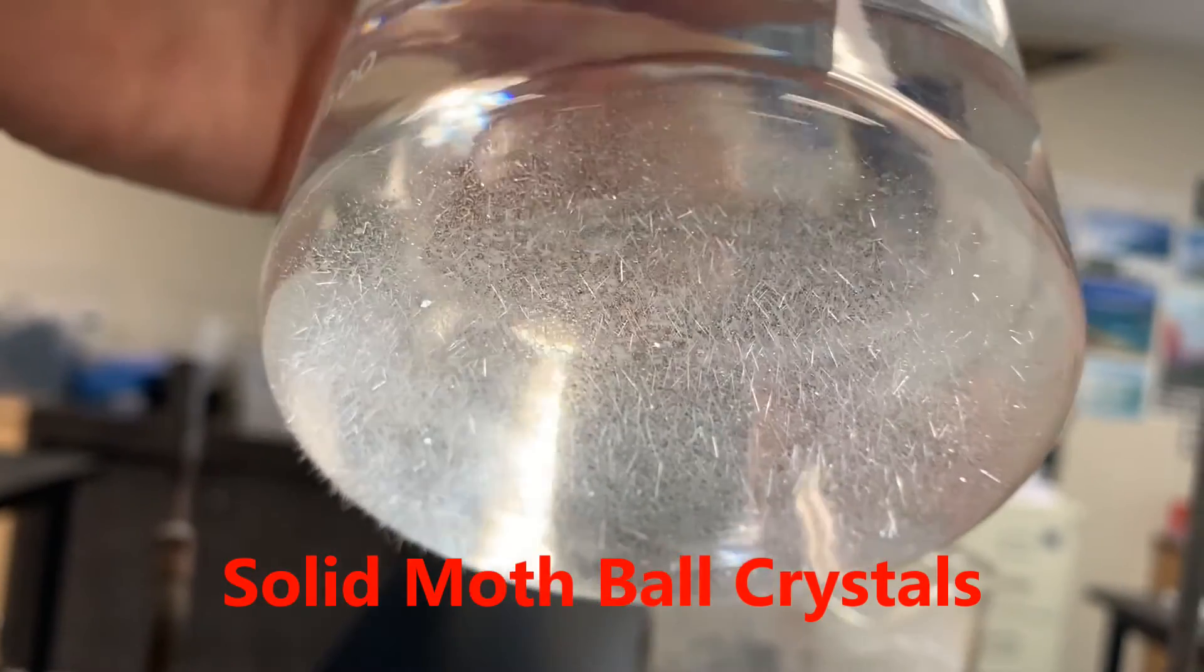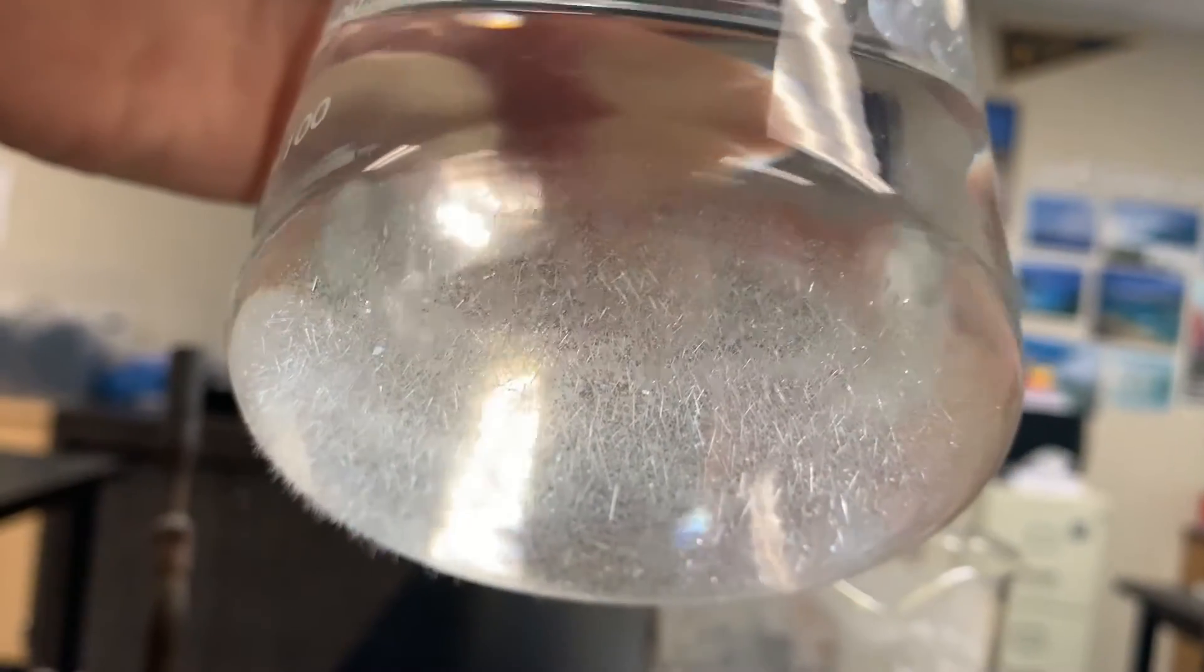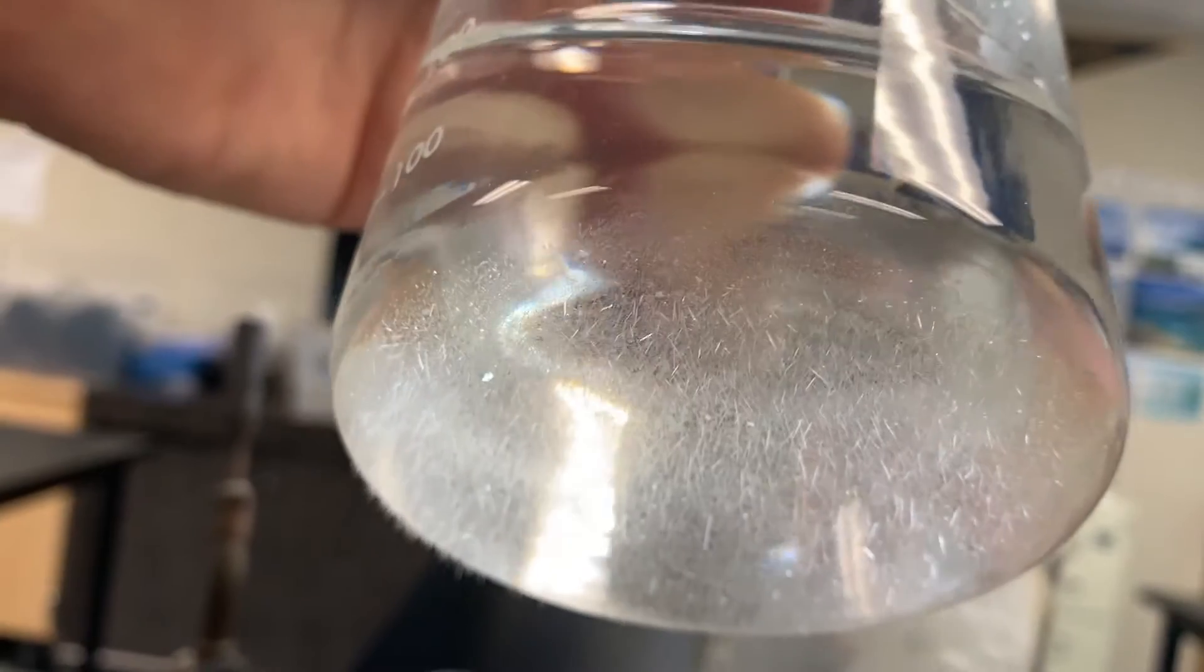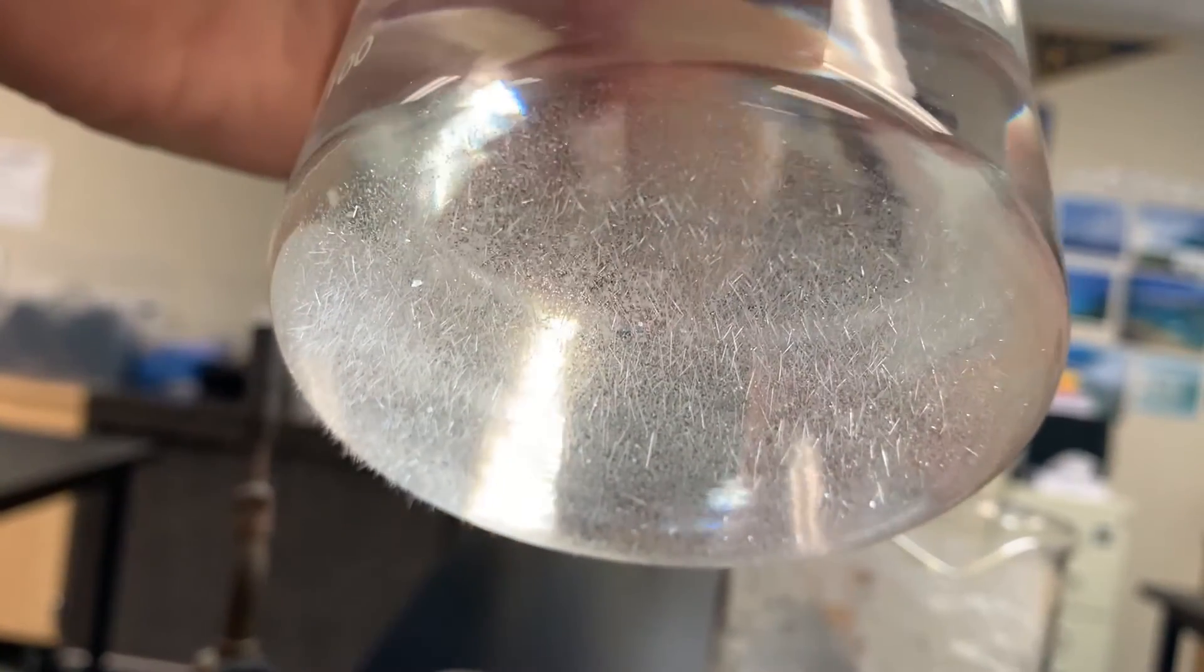That's solid that has reformed on this cold water beaker because the cold water caused the gas, which had high energy, to cool off rapidly. And it made these beautiful looking crystals on the bottom of the beaker.